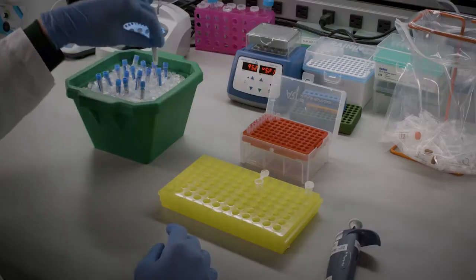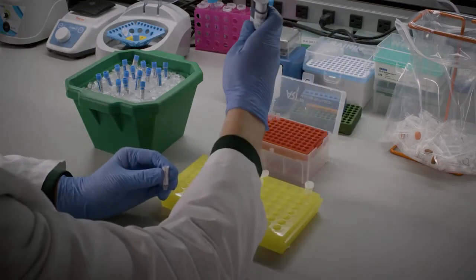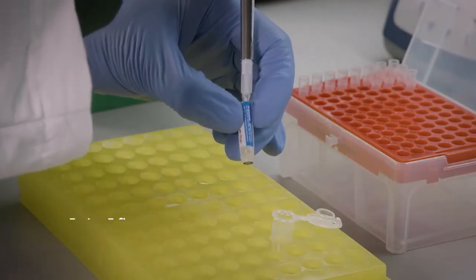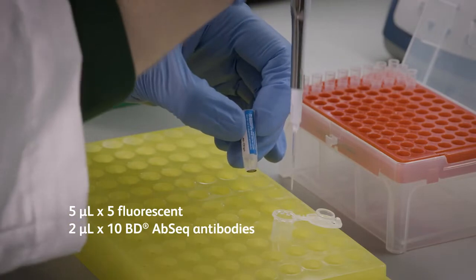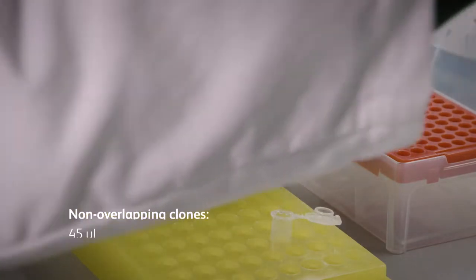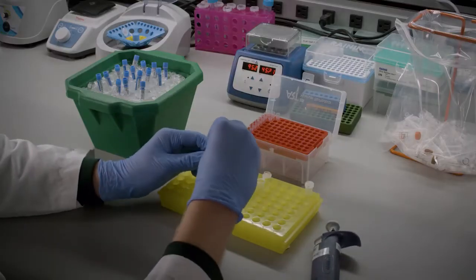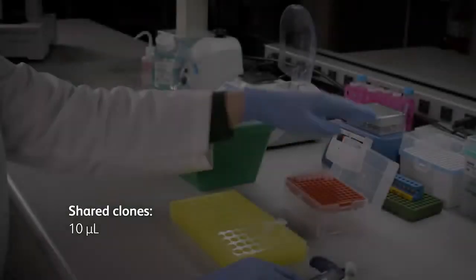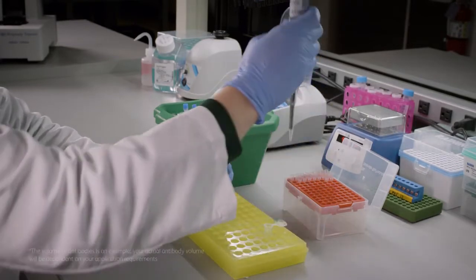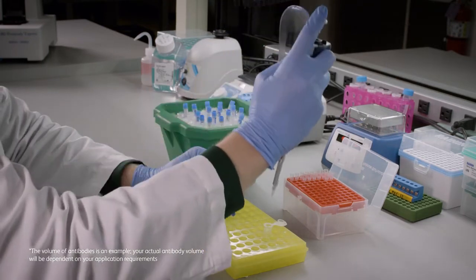We will next calculate the volume of each additional antibody used in the assay that has a unique clone. In our example, we have 5 fluorescent antibodies and 10 AbSeq antibodies. We will be using 5 microliters each of 5 fluorescent antibodies and 2 microliters each of 10 AbSeq antibodies for a total of 45 microliters of non-overlapping clones. We add this value of non-overlapping clones to the previous total for the shared clones for a grand total of 55 microliters of antibodies. Pool the non-overlapping antibodies in a separate tube from the overlapping ones because they will be added later in the staining process.